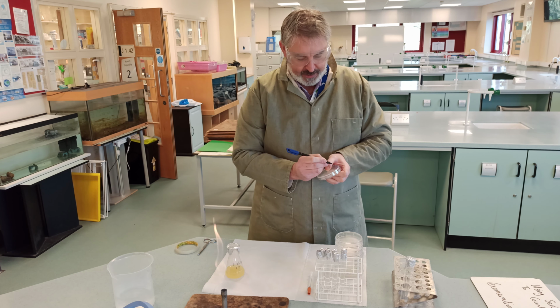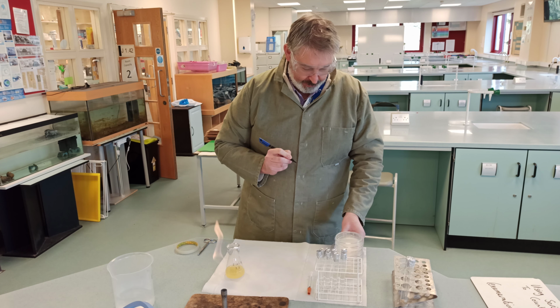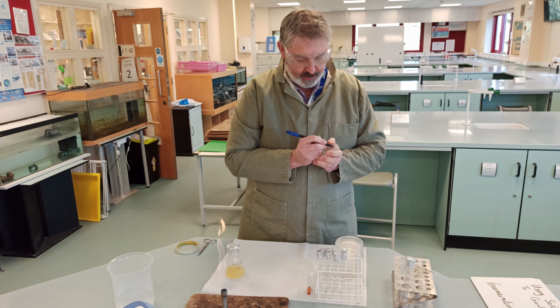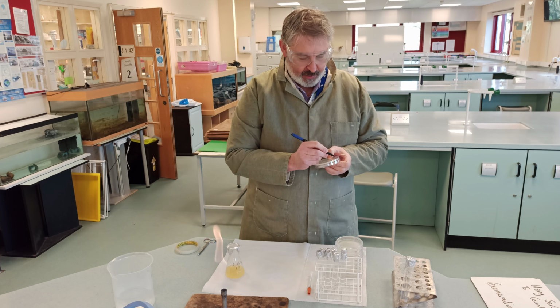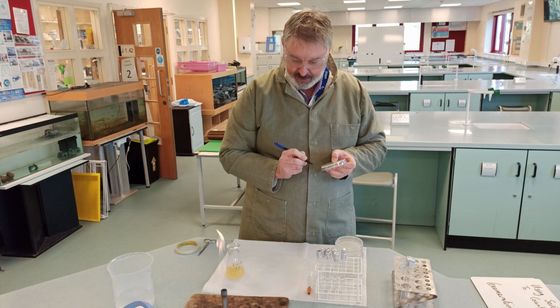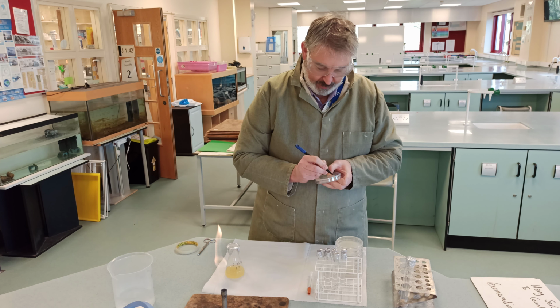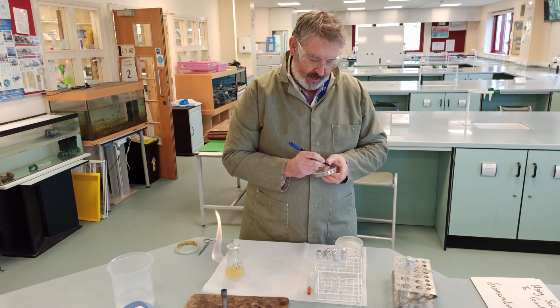So in fact what I could write on this is going to be times 1. Okay, so what I will do is then write on this one 10.2.21. Okay, I should write E. coli. I'll go back and write E. coli on the one, and we put the strain of E. coli, which is K12.